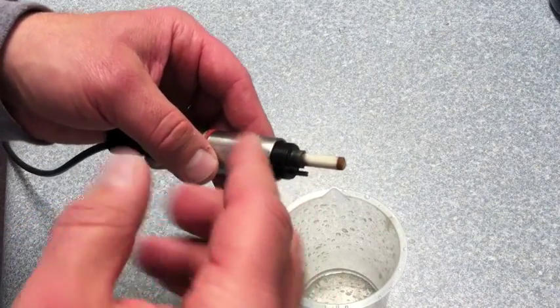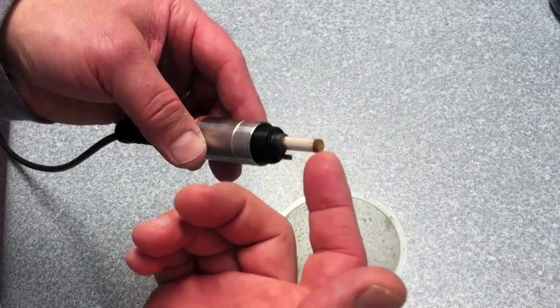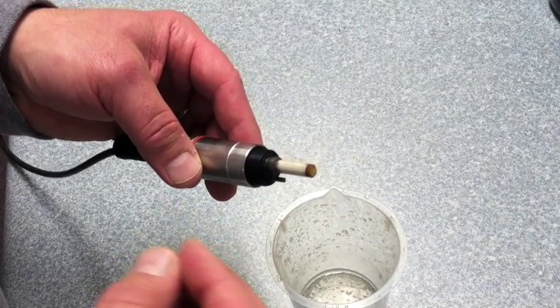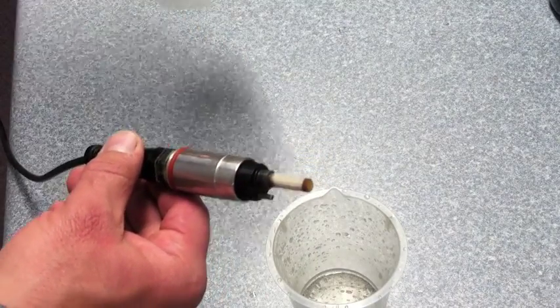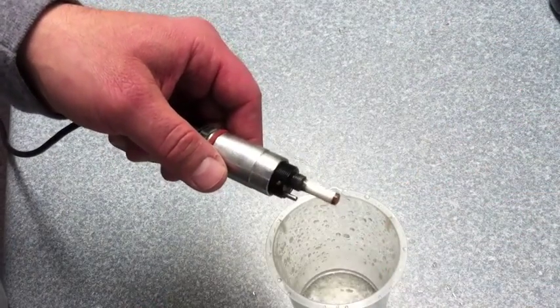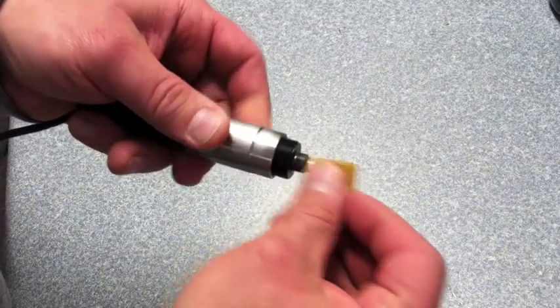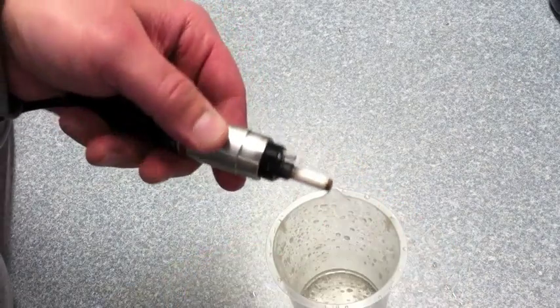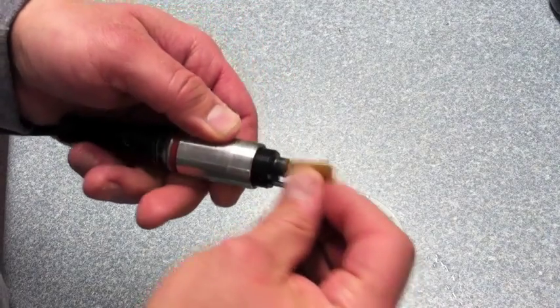Keep in mind, when you're doing mechanical maintenance on these probes, that the thickness is only about the thickness of a sticker, so you just want to be very gentle and only clean as much as you have to. As you can see in this probe, it's fairly clean, and normally you wouldn't do a whole lot of cleaning when it's fairly clean like this. I'm just going to show you, go down and around your probe as you're rinsing with distilled water, and just work your way around.